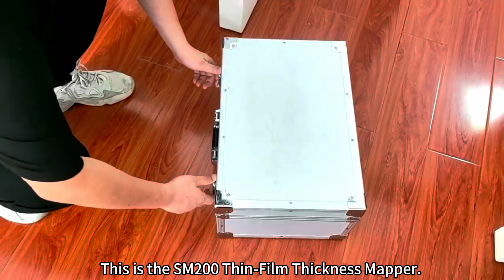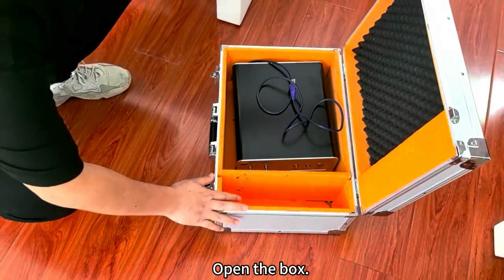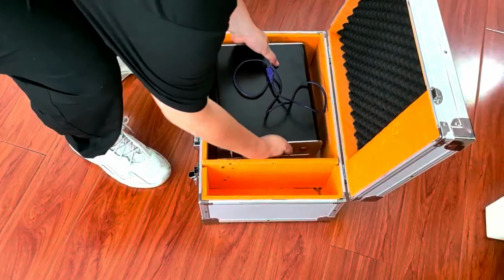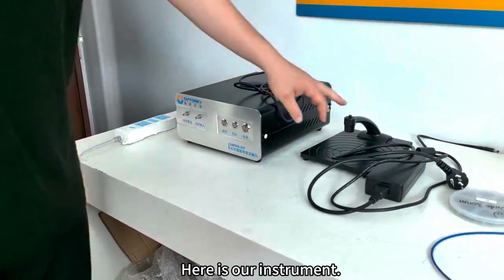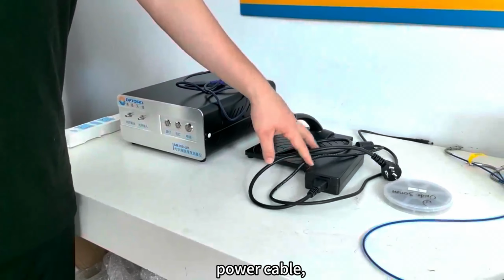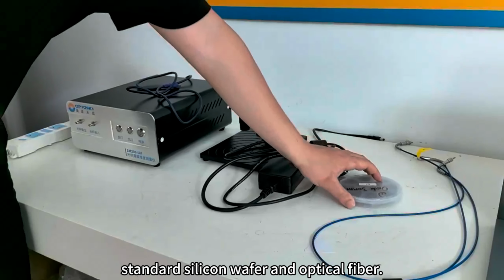This is the SM200 Thin-Film Thickness Mapper. Open the box. We take it out. Here is our instrument. This is our sample stage, power cable, standard silicon wafer, and optical fiber.